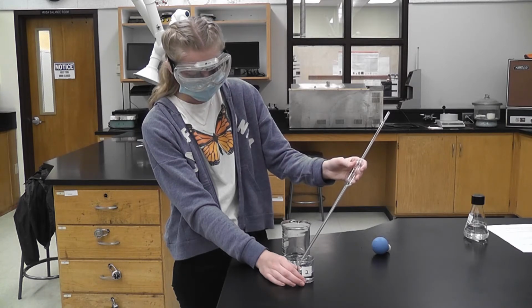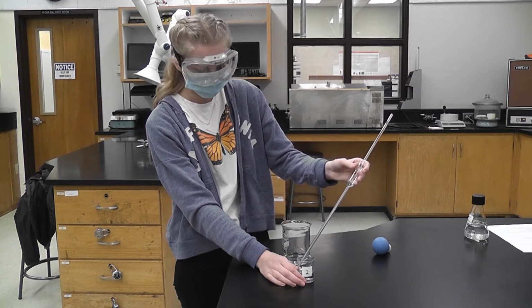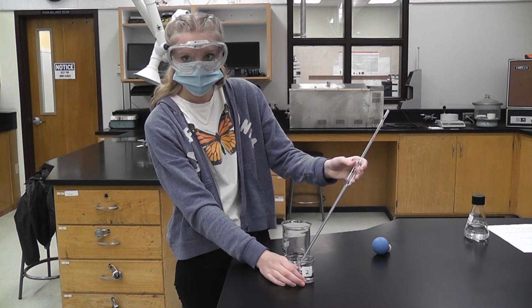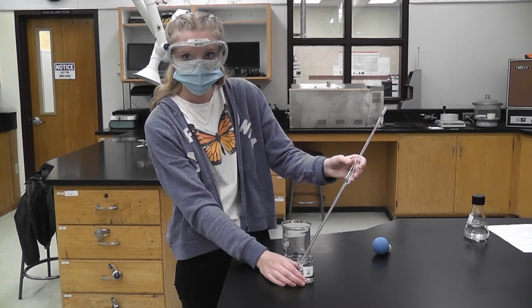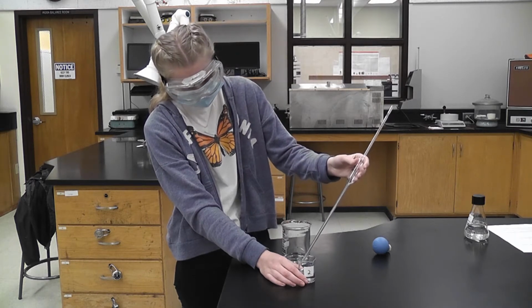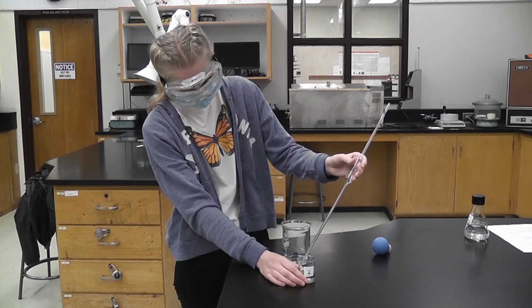Okay, so then it hits the tip, and then we wait 30 seconds? Yes. The droplets which stay there are already calculated for, so we don't have to push them out. Oh, okay.